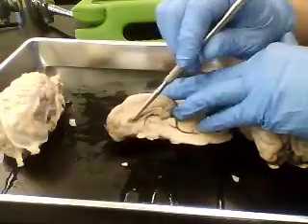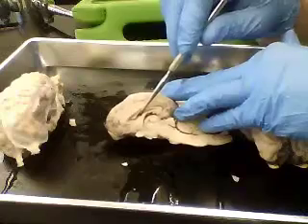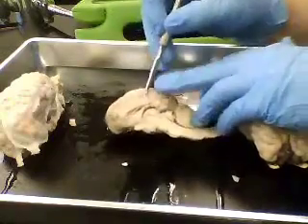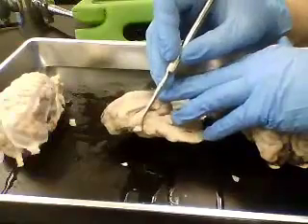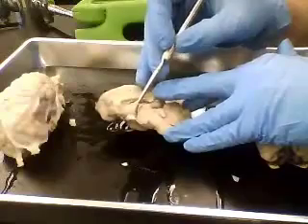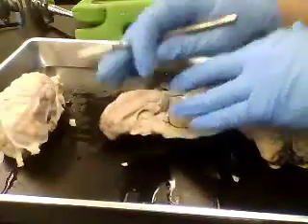There is a space in here. I'm inserting the probe into it and up. That would be one of the ventricles, which in a living brain would be full of cerebrospinal fluid. Cut through here as well, you can now see this very clear round area would be the cut through of the optic chiasm. If we turn it on its side, you can see where the optic nerve would be. That's a very important landmark.